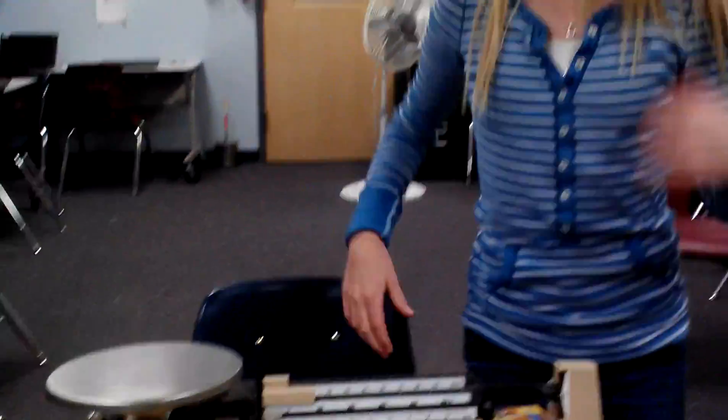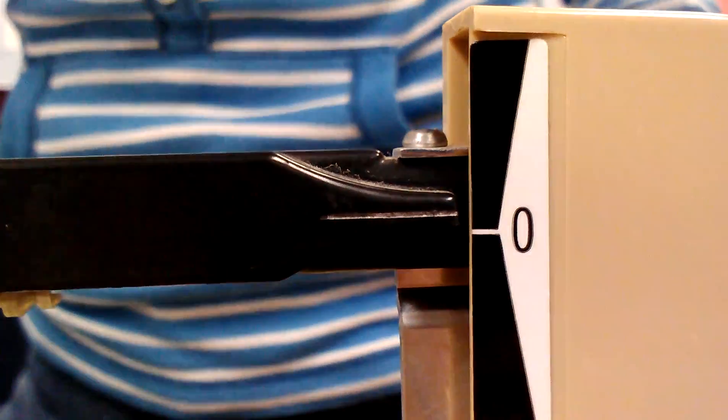Okay, so first you need to line it up with this notch right here. So what you want to do is you want to line it up. So I twisted the object and it got to zero. You still got to twist it just a little bit more. So after I twist it, you might have to twist it again if it didn't really work. And after a while, if you just can't get it, just try to get it as close as you can.